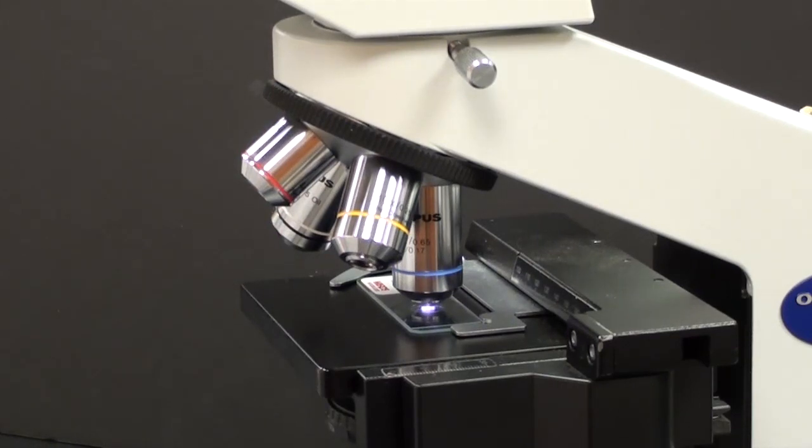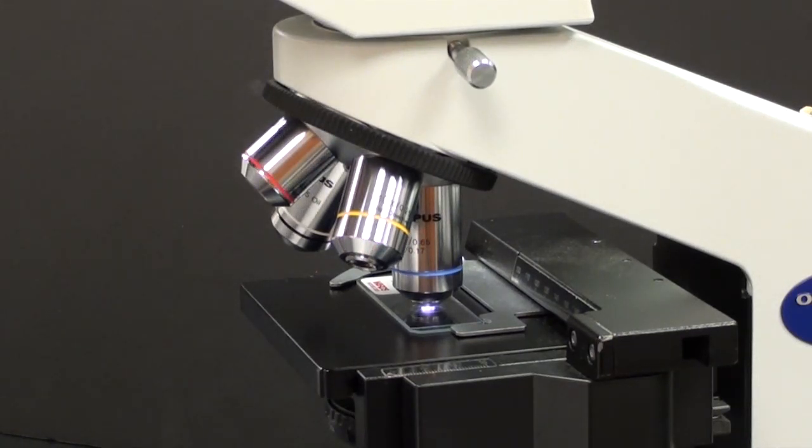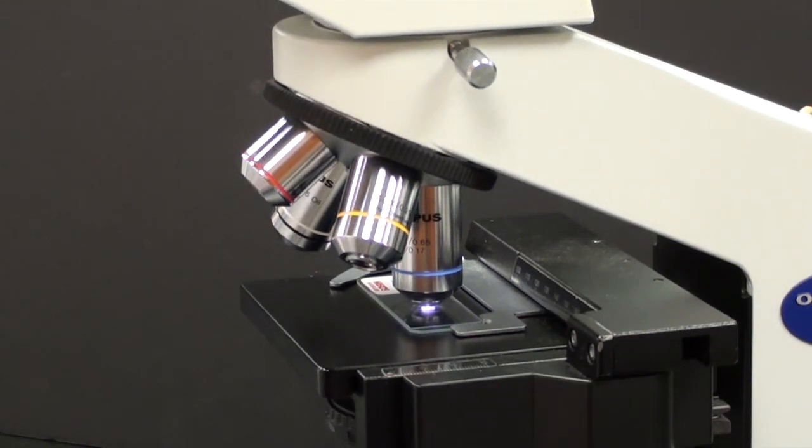In this case, it's a 40x lens. When we're using it, we're magnifying the specimen 400 times. This is the high dry lens. Because the microscope is parfocal, this means all we need to adjust is the fine focus. The specimen may not be exactly in the center of the field of view, but it will be visible.